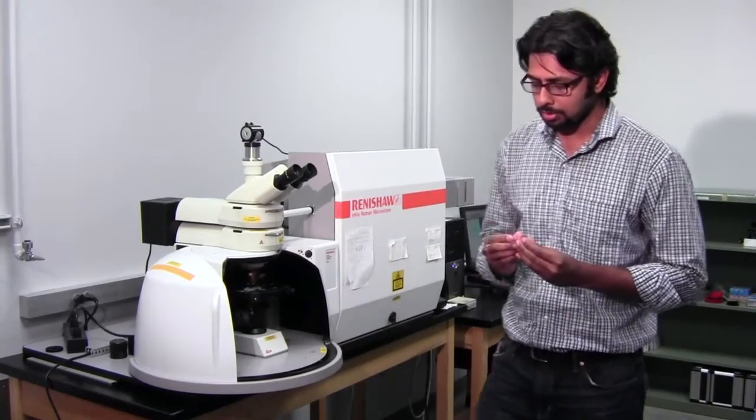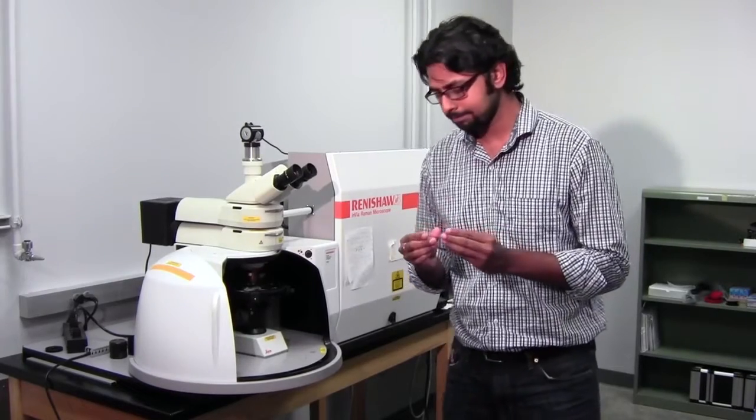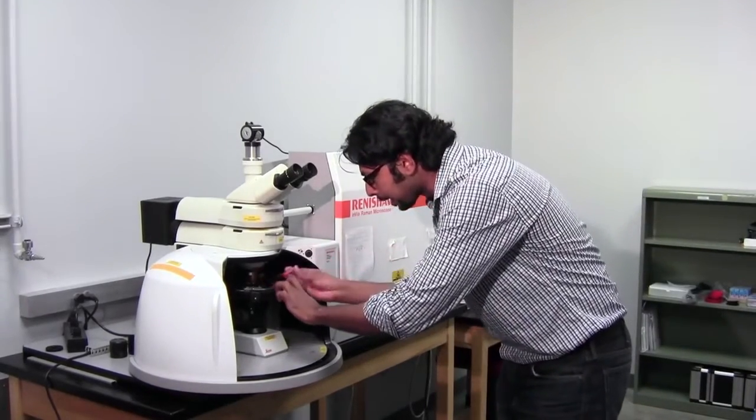What you basically do is first you take your sample of interest. Here I have got some nail polish on glass slides, simple glass slides. Place your sample under the microscope.